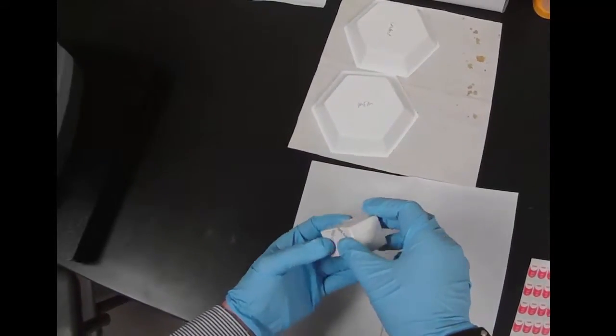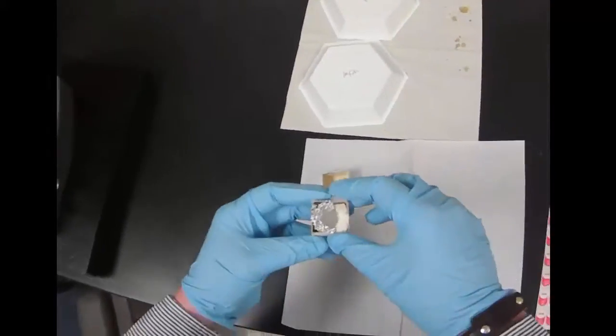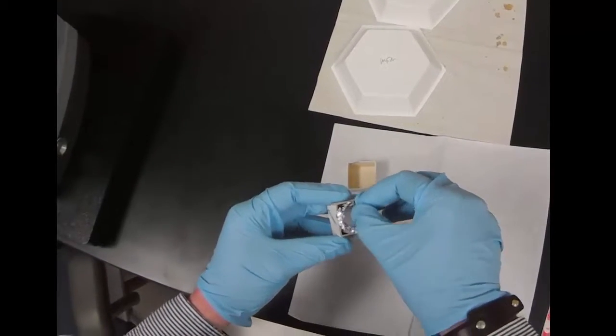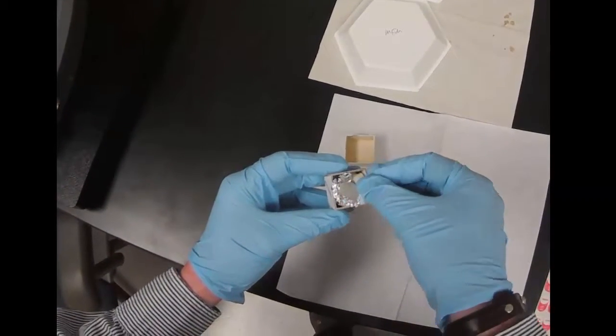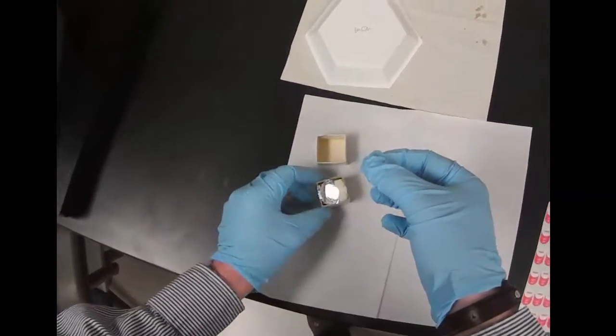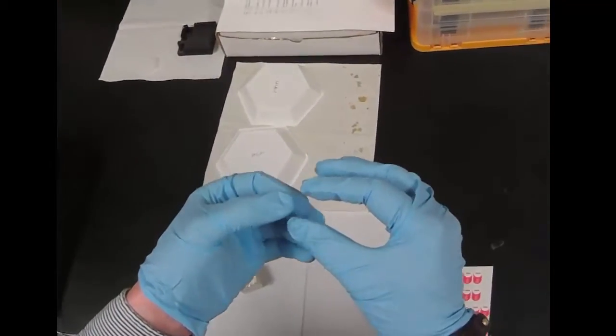We want a flat surface for it though, so we're going to grab a cover slip. But you want to be careful, this is thin glass.